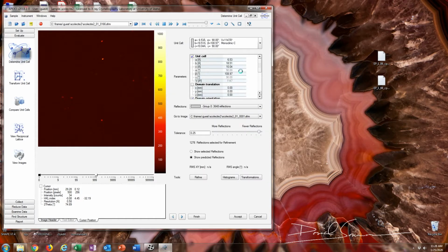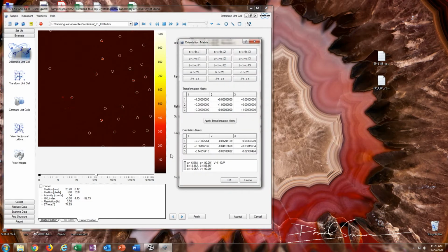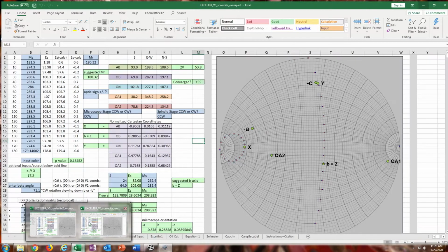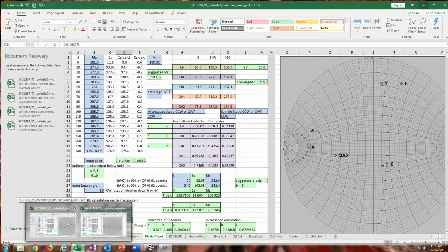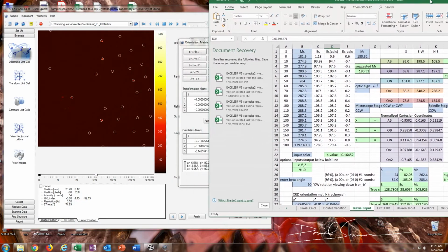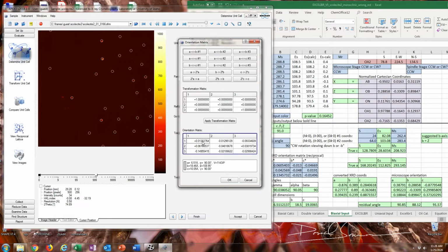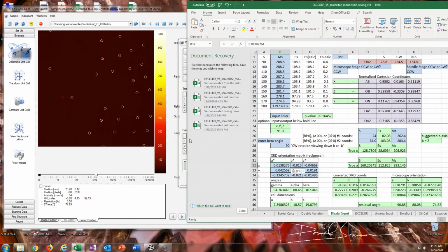I mean, it could be triclinic, but it's unlikely in this case, but most likely it's monoclinic, especially with that really high figure of merit. But now we have to find the correct monoclinic setting, because this has to be monoclinic C. There is such a thing as monoclinic F settings, but that's a non-conventional setting. So we have to find the correct C lattice setting, and that is quite a chore in this case.